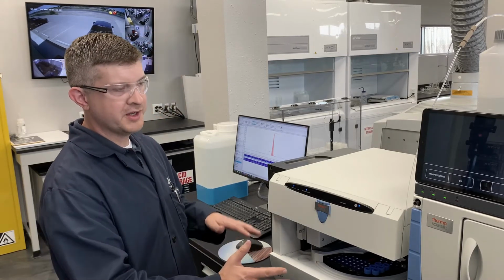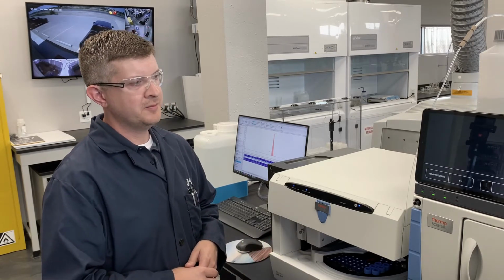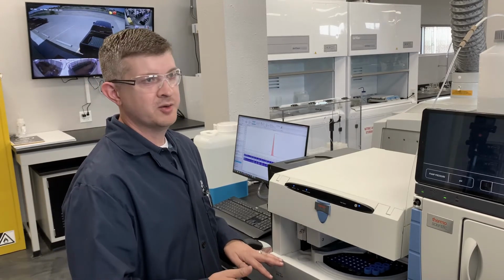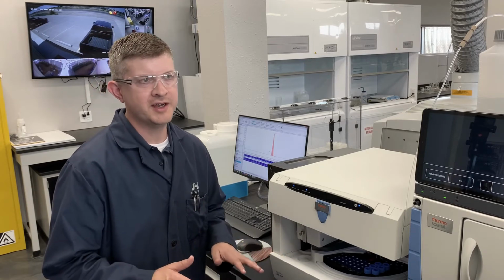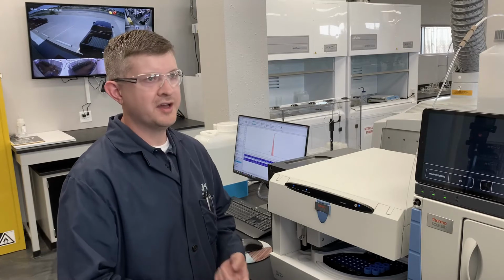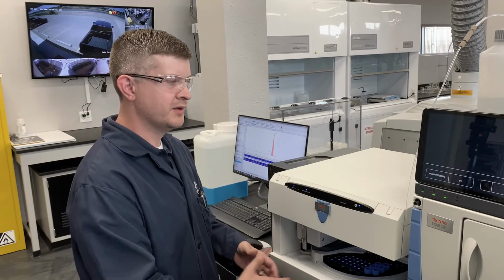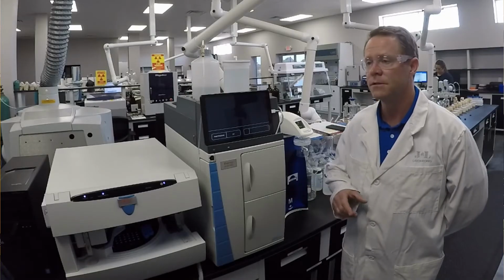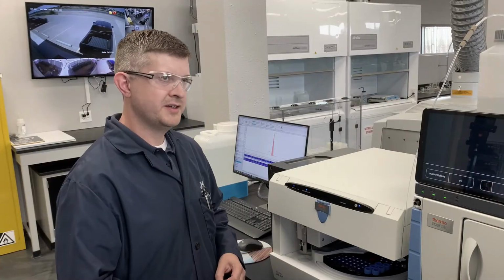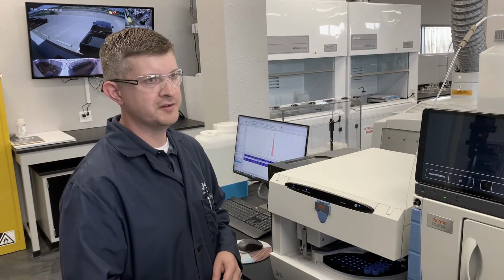And in terms of running the other items that we do, the chlorides and the sulfates, compared to the Hach method, it's not even a comparison, because if you look on the website for Hach, you're going to see some interfering species with the sulfate measurement: calcium, magnesium, iron. In high enough concentrations, they will interfere with the sulfate packet. This is used in combination with your ICP to get the complete water analysis. So apart from organic acids, we do employ this to monitor our chlorides and sulfates for us.